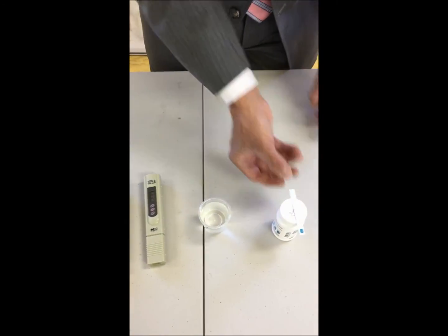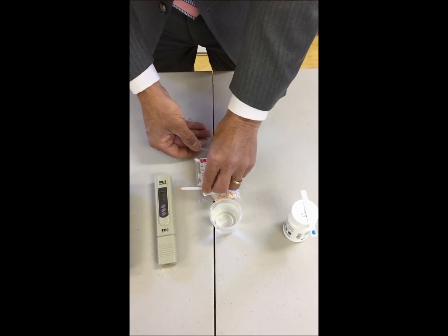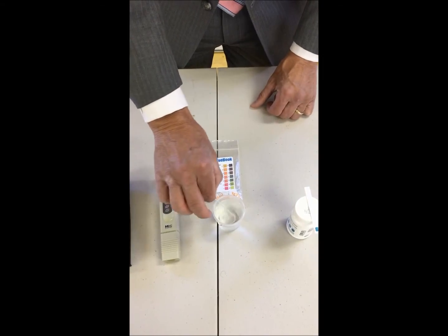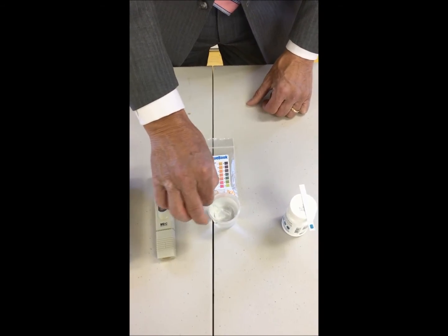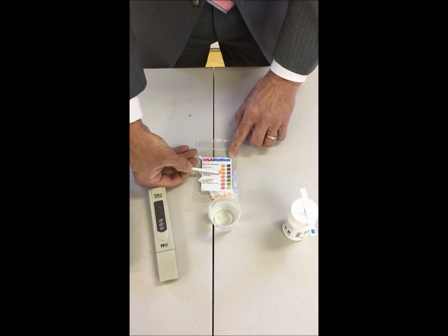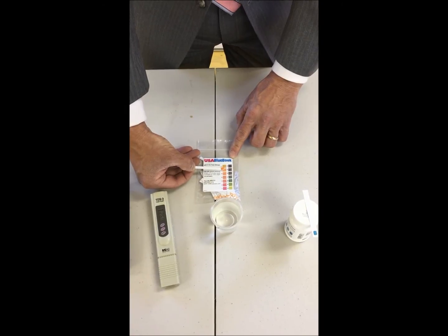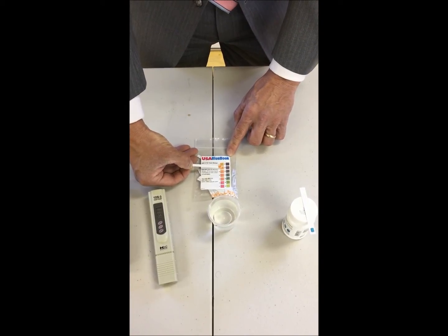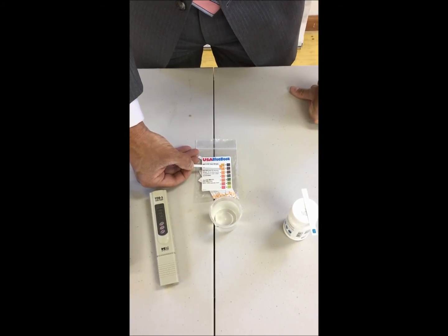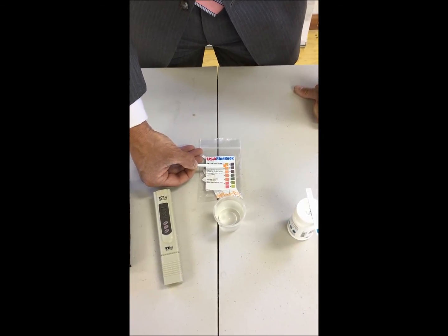The next test we would do then is for pH. Again, take a very simple dip slide out, put it in the water, shake it back and forth, approximately 5 to 10 seconds, at which point you then pull it out, compare the color of this dip slide with the color here. In this case, it looks like around 6.0. 7 is a little bit too much, so 6.0. I would record the pH there as 6.0.